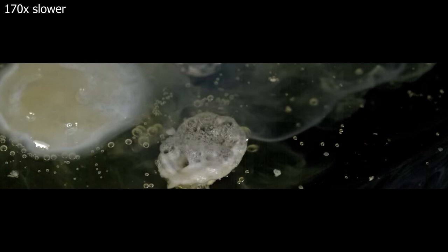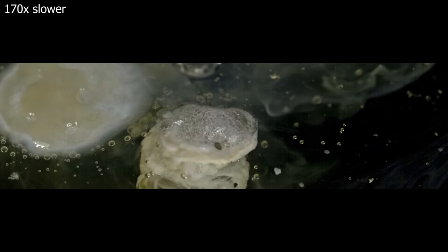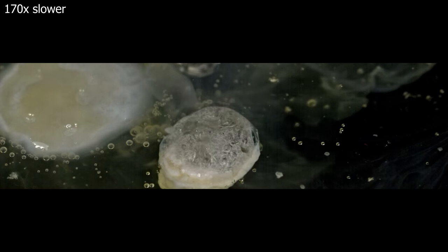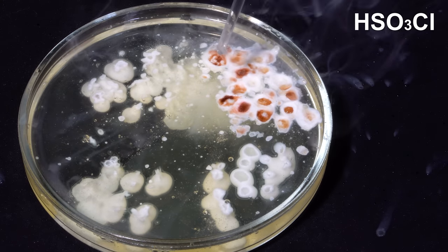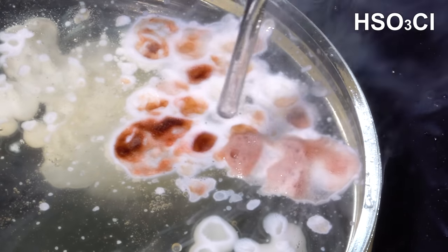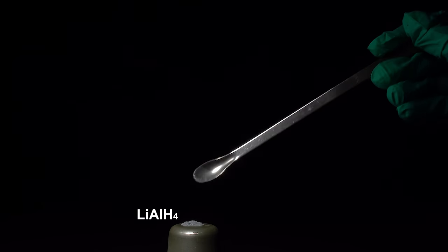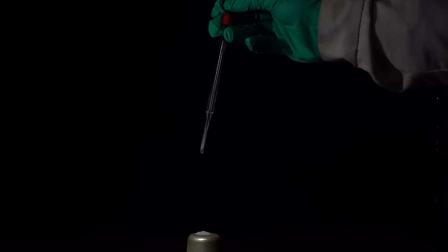You can also manage to remove the water. A spectacular reaction occurs when chlorosulfonic acid interacts with lithium aluminum hydride. It's very nice to look at, especially in slow motion.